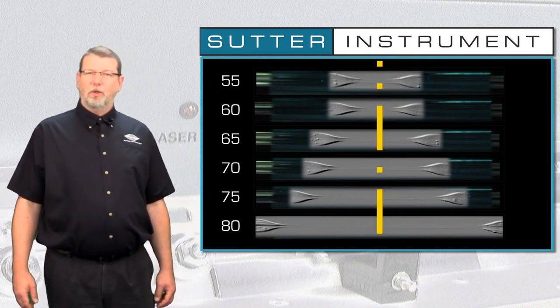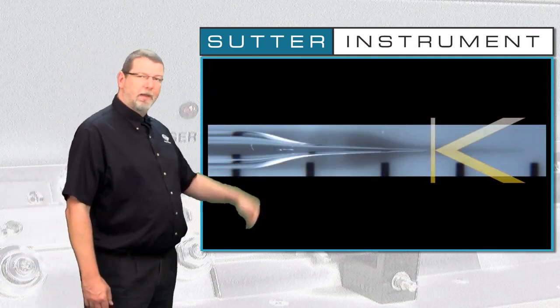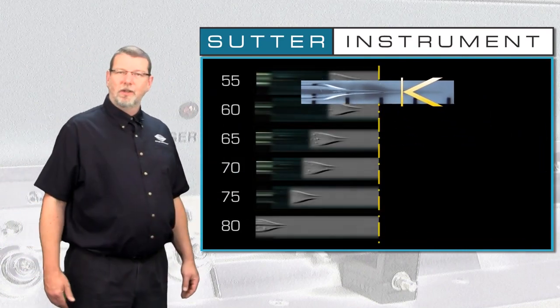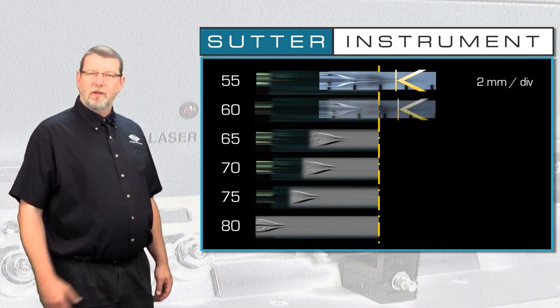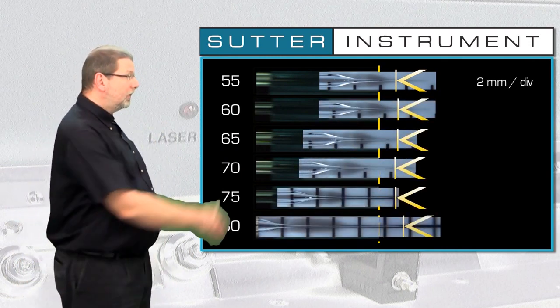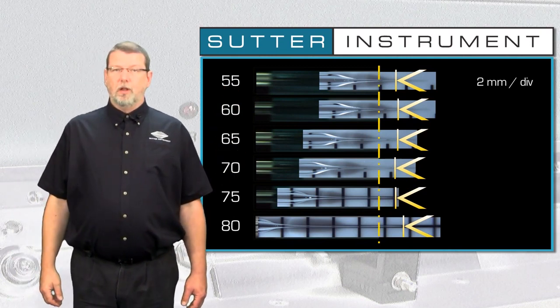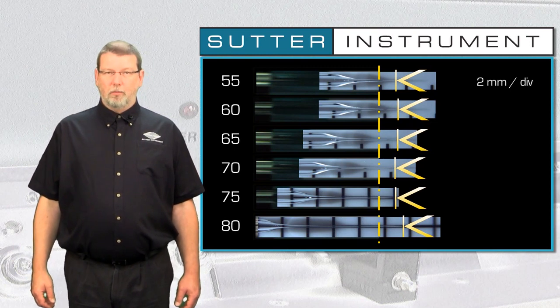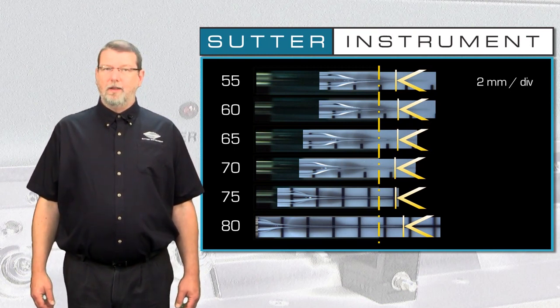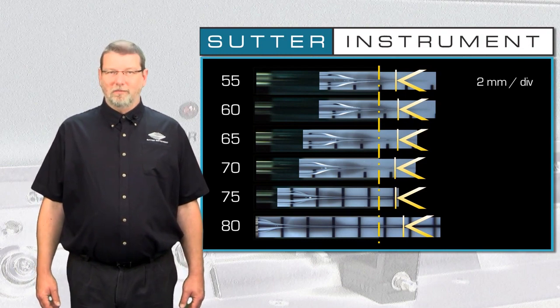The last thing we want to look at in this tutorial is how the final pipettes relate to the hourglasses for each of the different velocities. If we superimpose images of the pipettes over 1/2 of the hourglass, we see that that portion of the tip that extends beyond the hourglass changes very little between different velocities. This zone of the tip is largely determined by the last line of a pull program, in our example, line number 2. But that's the topic for its own separate tutorial.